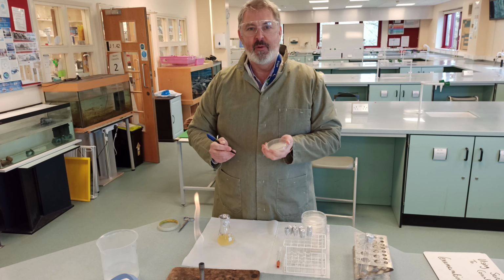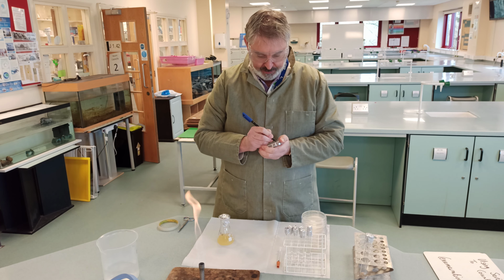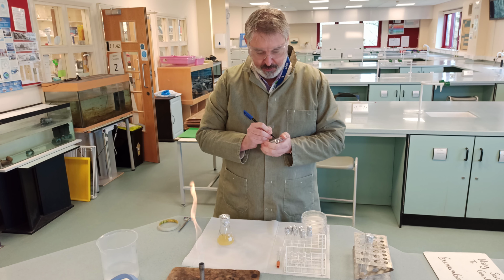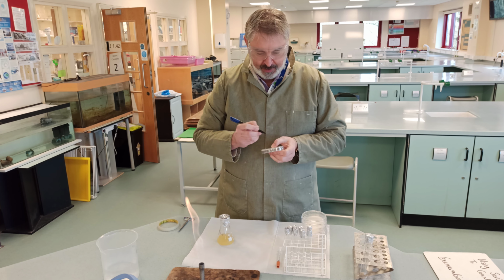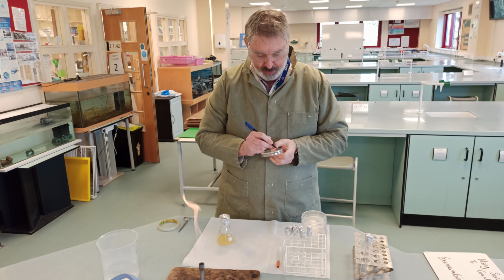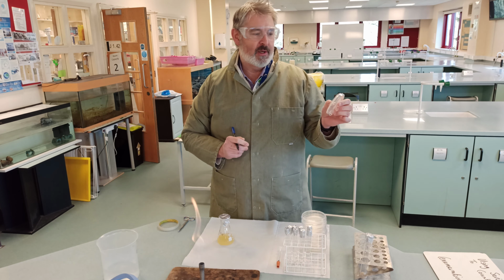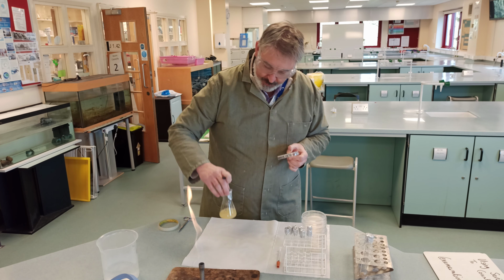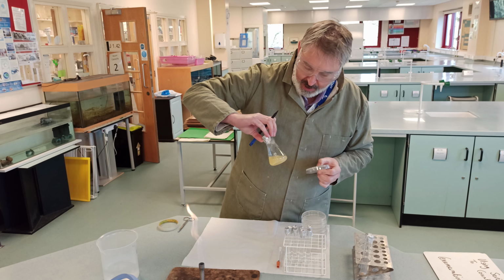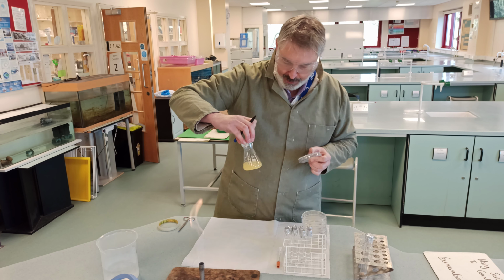Okay, so on those plates I will need to put down the date, which is the 10th, 10.2.21. Okay, and I will put 1 ml here. So I'm going to be taking a milliliter of this Escherichia coli broth that was started on the 5th of February.